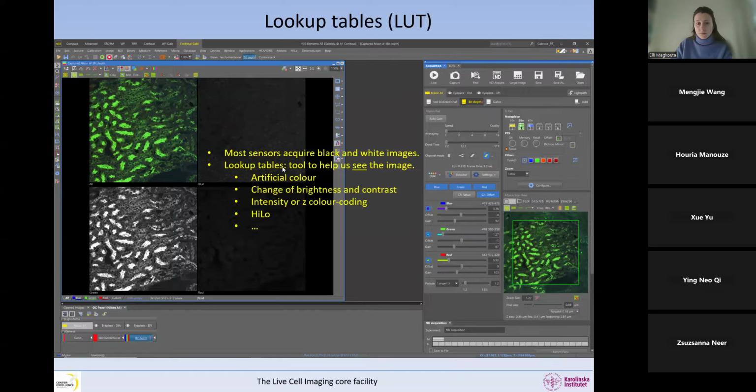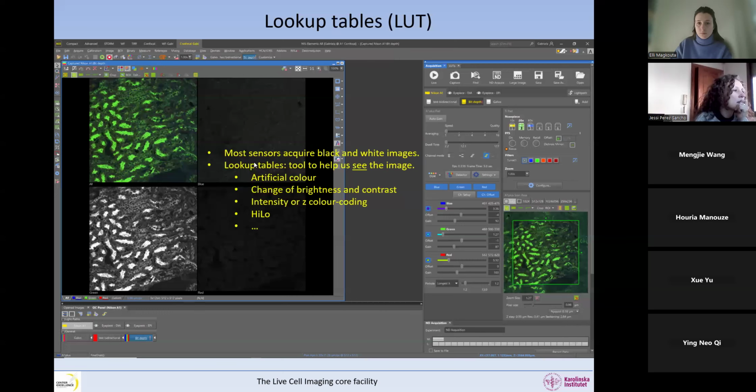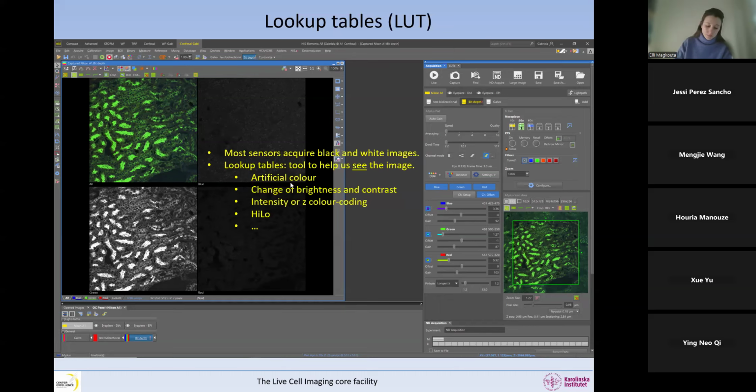Don't ask me where it comes from, but lookup tables, these are tools. They are abbreviated as LUT. Some people say LUT. They are tools to help us see the image, okay? So we can, for example, put an artificial color. Again, these images are acquired in black and white, but we can put an artificial color on it, and then we can change the brightness and contrast.